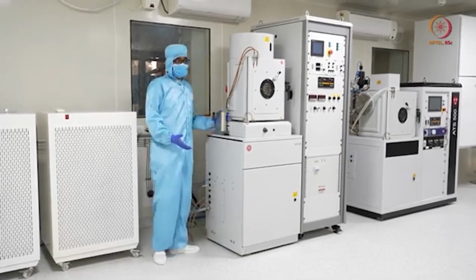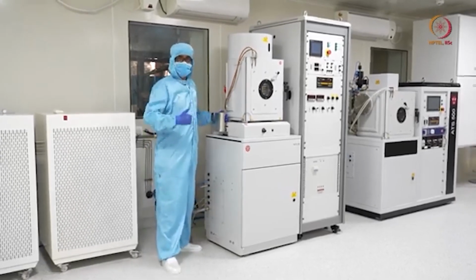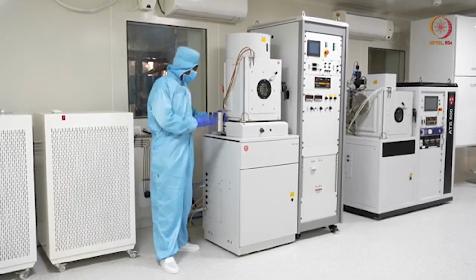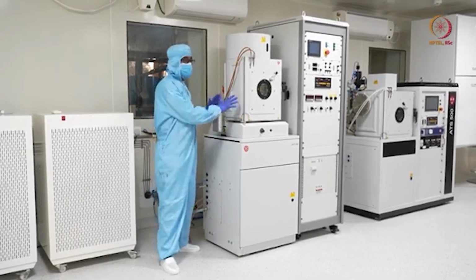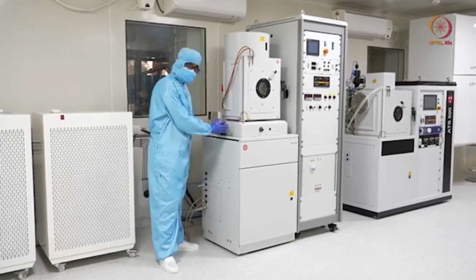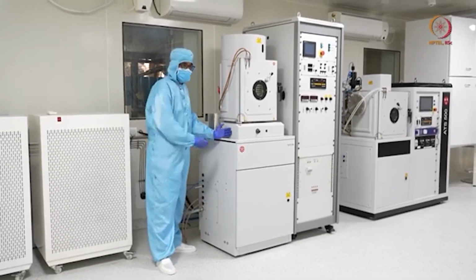As you already know, liquid nitrogen has a temperature of more than minus 150. That will help to get all the molecules at the same place, so that it will be easier for the pump for suction.